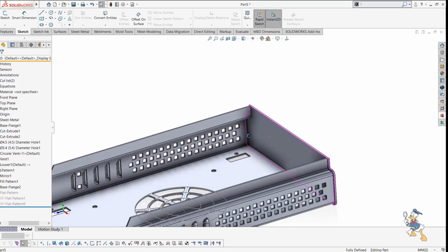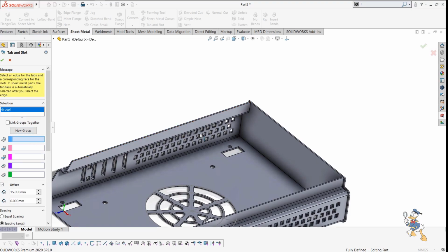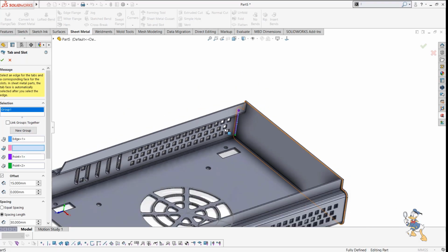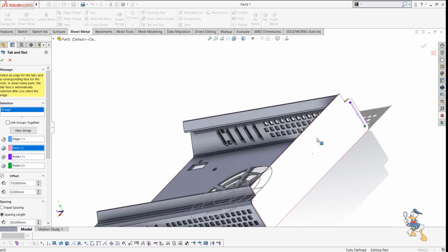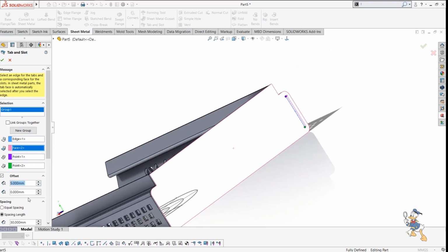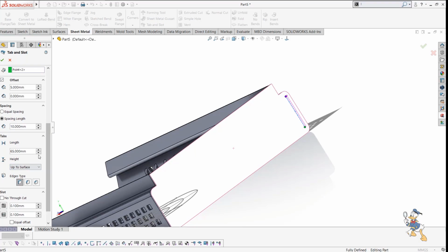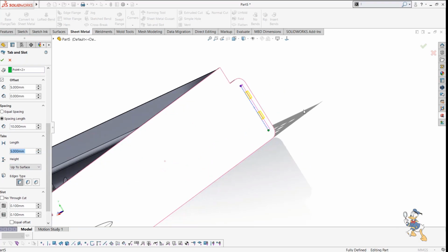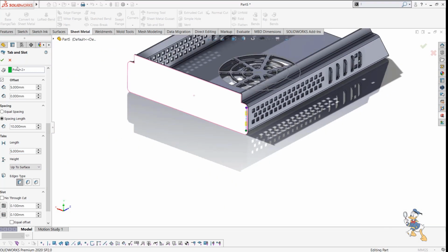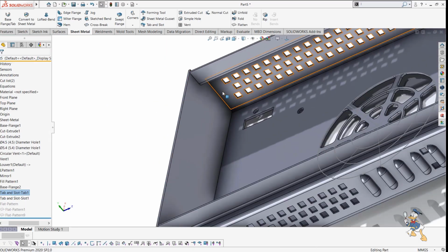So for joining these two parts, we have another sheet metal feature known as tab and slot. Usually, while welding, we need some guidance for generating this kind of part. So by providing this feature, I just need to provide an offset distance of 5, a spacing length of 10, and the total length of the feature would be like this. I just need to check it. It is showing a preview of slots, and it seems okay to me. I just need to tick over here, and yes, the tab and slot is generated.